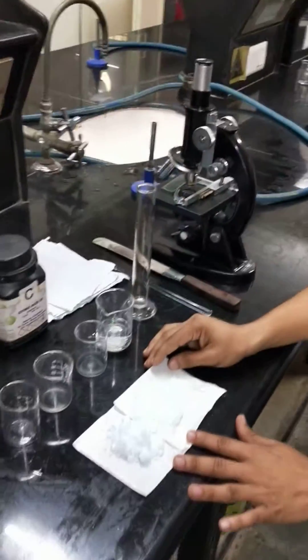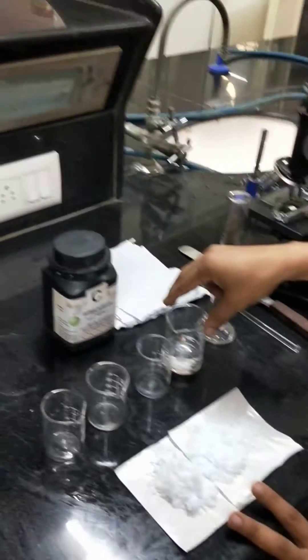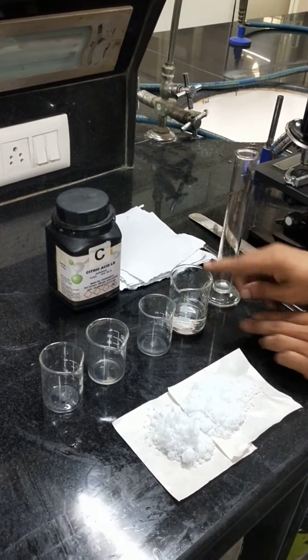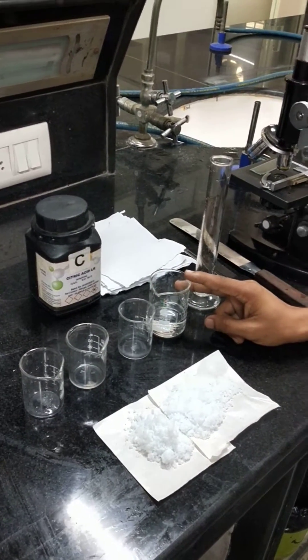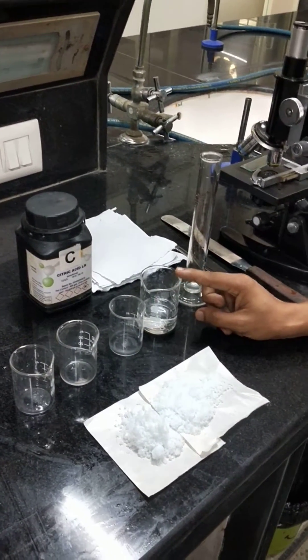Citric acid, 50 grams, has been weighed. Then we take 40 ml of water into a beaker and heat it to 50 degrees Celsius.